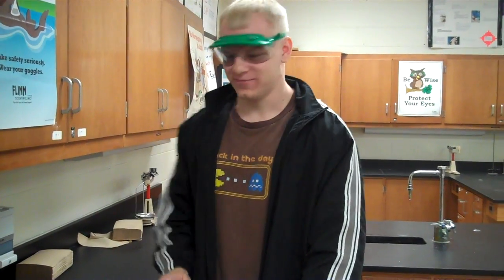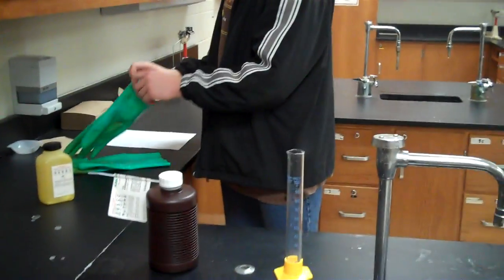This is Destin Arvola, and today he'll be performing the Aladdin's Lamp Experiment.